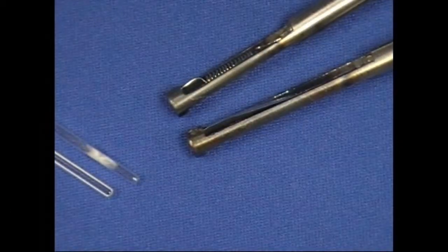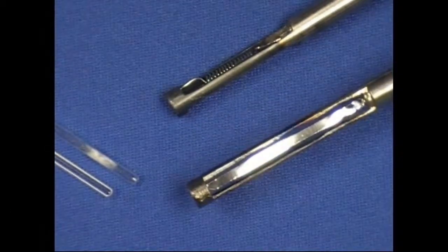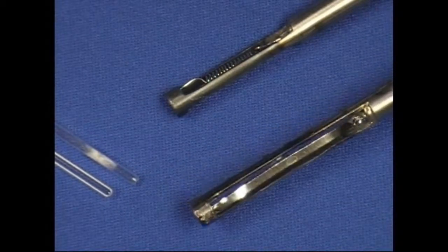I'll come in for a closer look. The ribbon probe is just a flat piece of platinum, and the sample is put directly onto the platinum for heating.